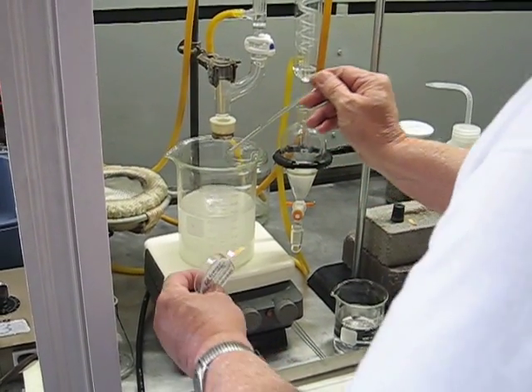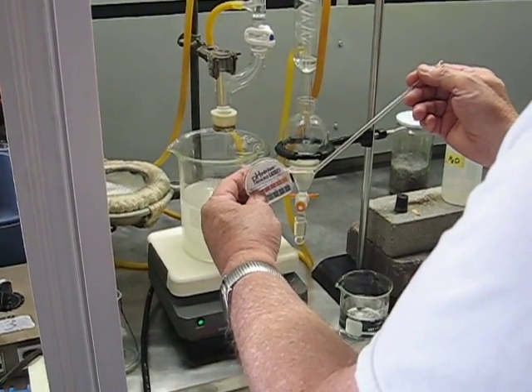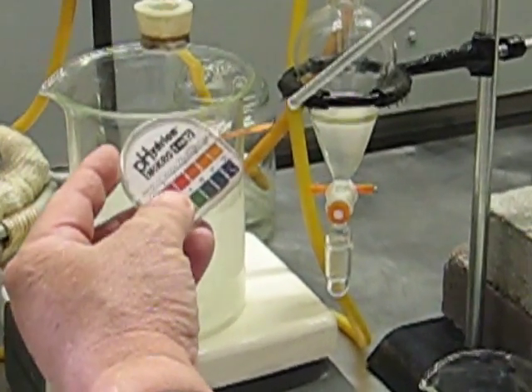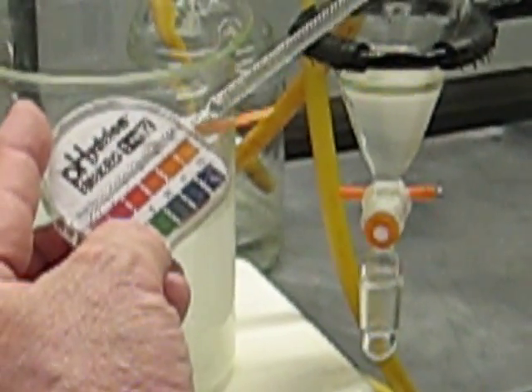I'll demonstrate that it's pH 6 right now. As you can see, it's just kind of an orange there, which is consistent with the color for pH 6.